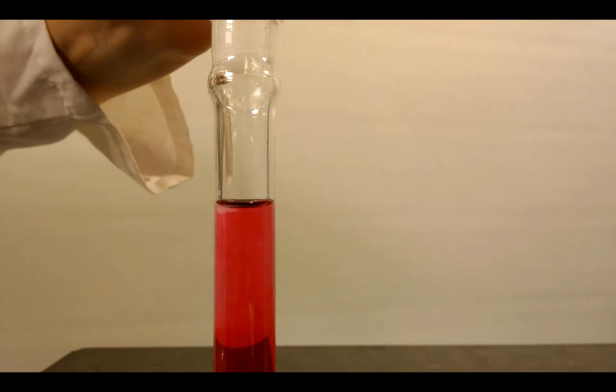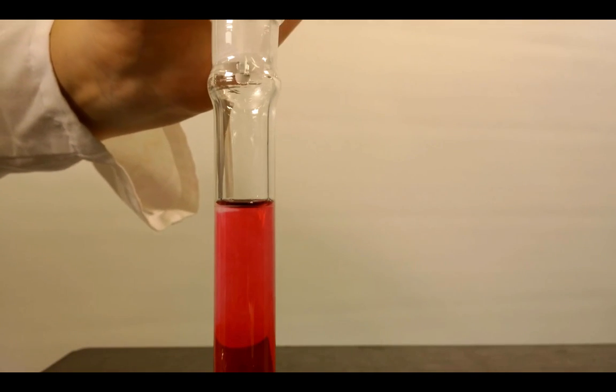Add drops of diluent until the bottom of the meniscus is in line with the calibration mark.